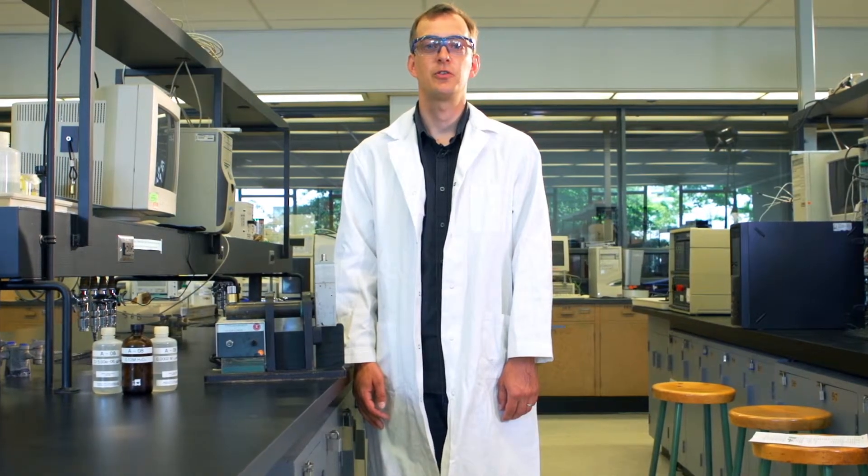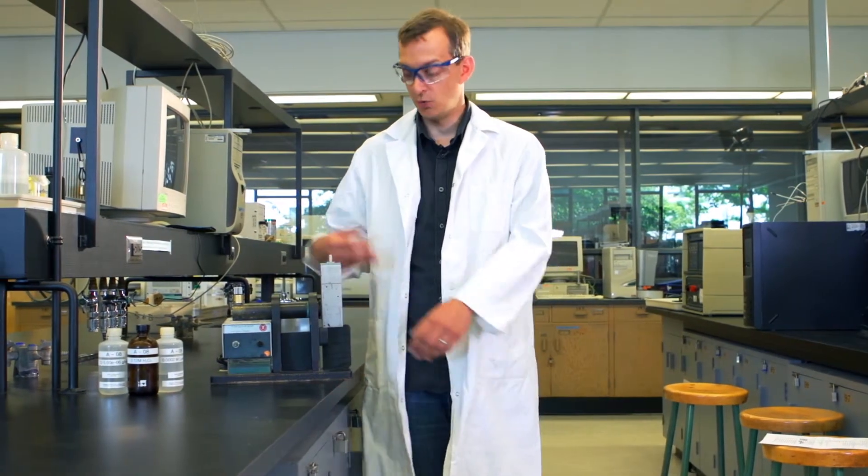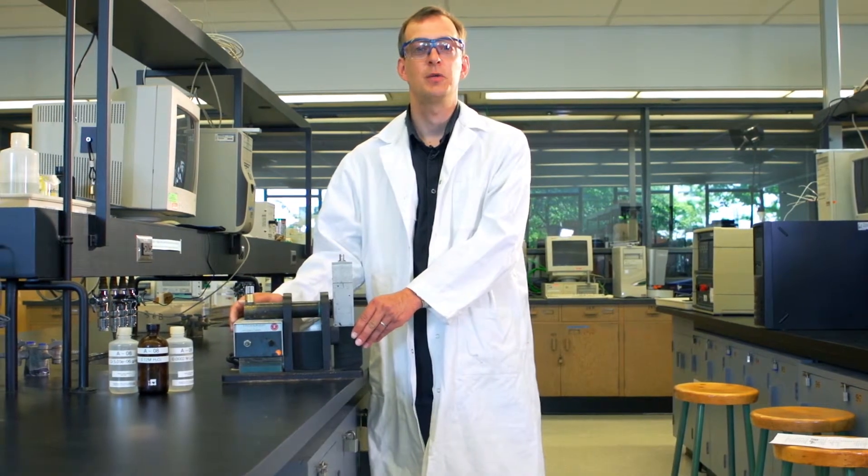Hello and welcome to the series of instructional videos for the third year analytical chemistry labs. I'm Dr. Robin Studley and this video will be about the instrumental setup for chemiluminometry.